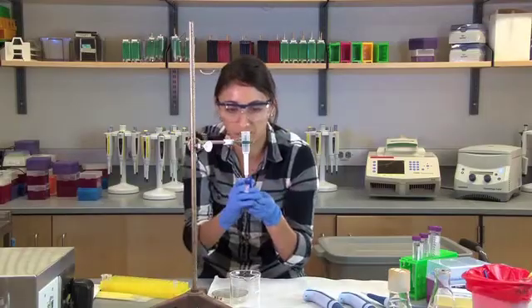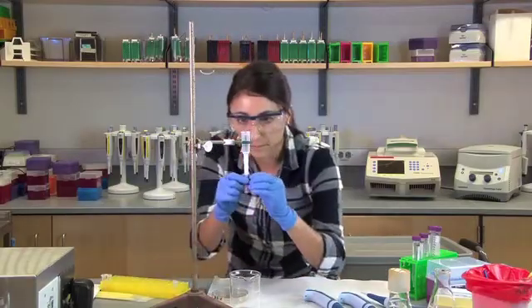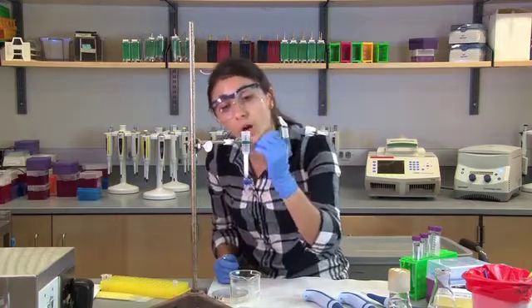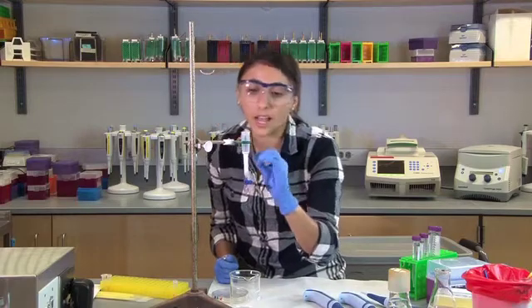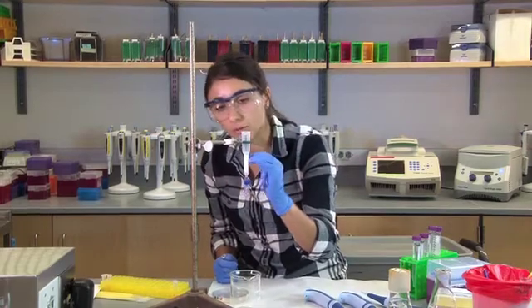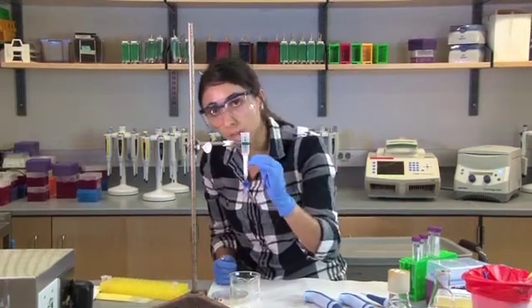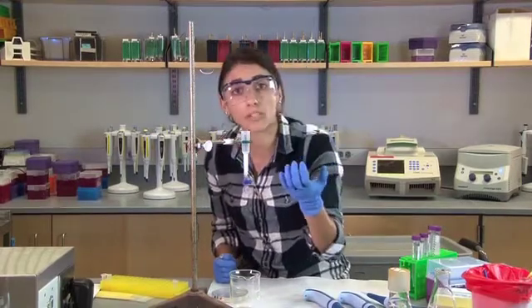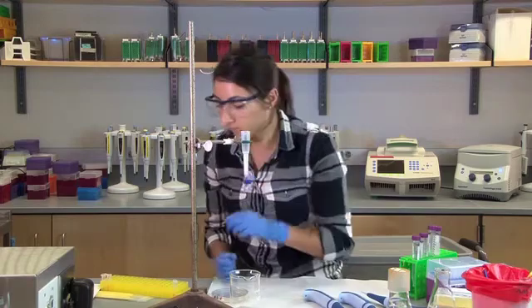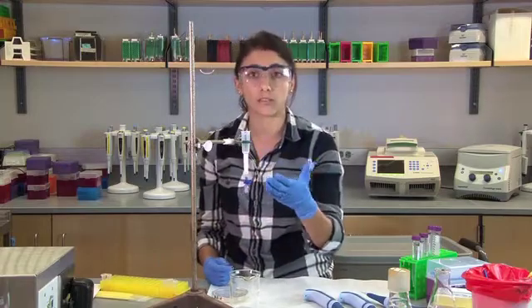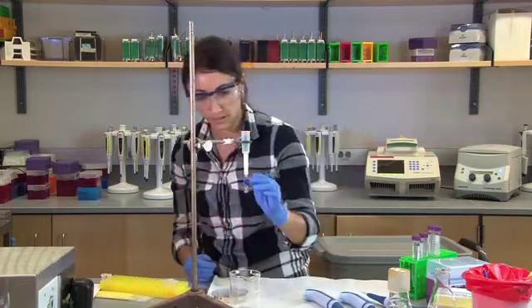Okay. I cheated with that one. But now I'm going to stop it. And one thing I've also been looking at is how much buffer is at the top. I don't want that buffer to move all the way down and to have my resin beads exposed to air. I want to keep those as hydrated as possible. So I'm stopping right here with about one to two millimeters of buffer at the top, which is what we started with. So that's okay. I will be adding a fourth buffer, the CEB buffer, to wash everything out and get this column ready for use again. So that's done. So I have two tubes.